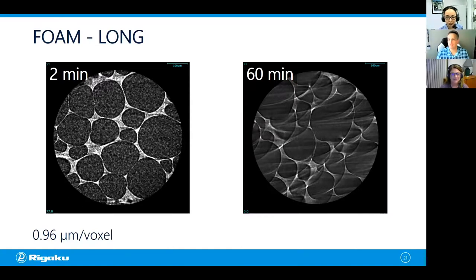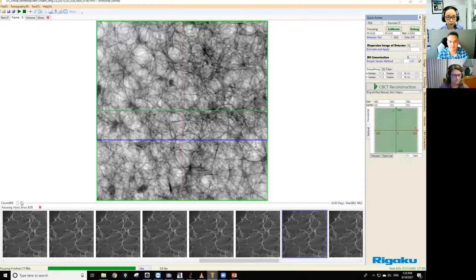You must have watched your first session. Yeah, we did talk about this in the part one session. So let me switch the screen and show you the center correction. Okay, so this is the 60 minute scan.